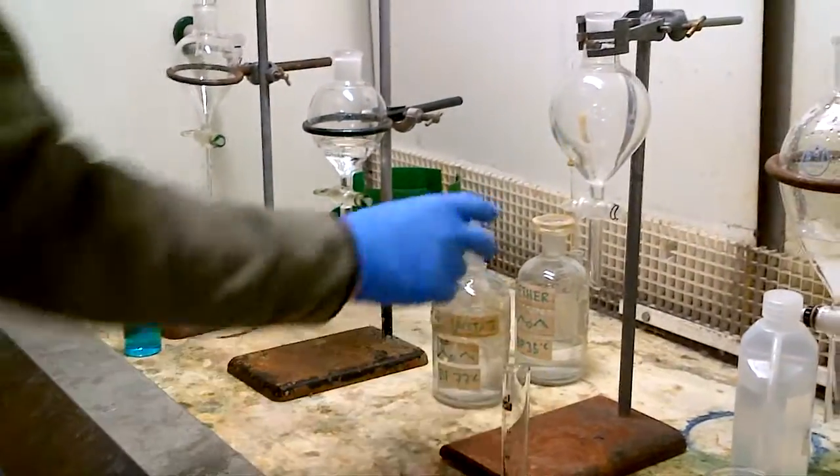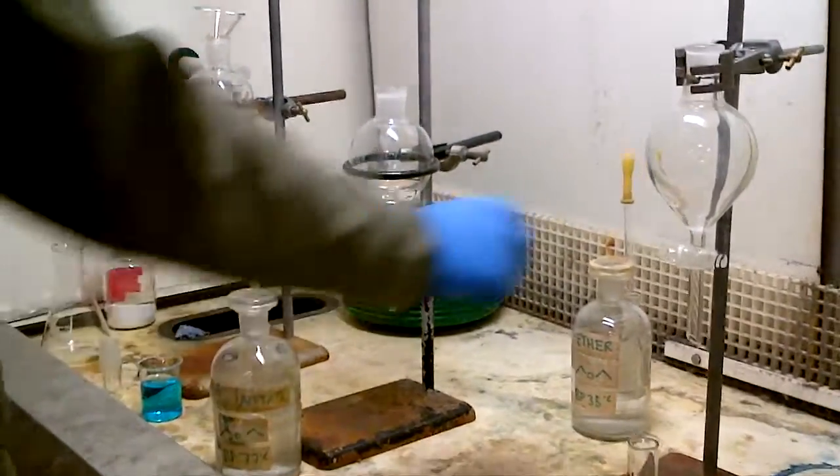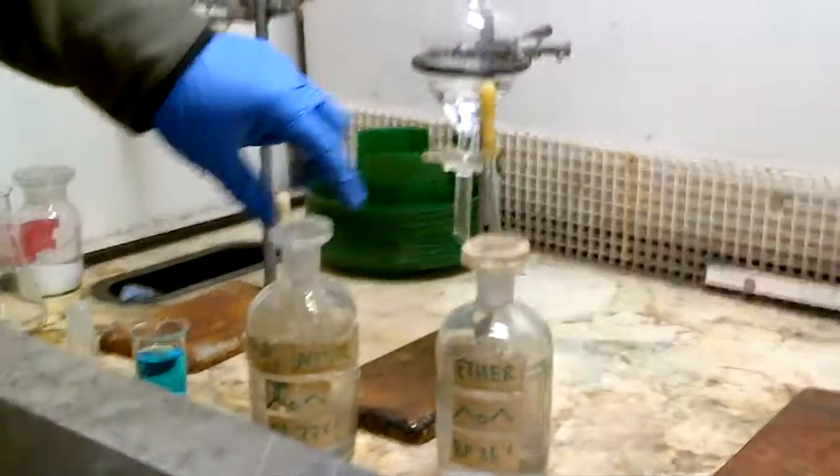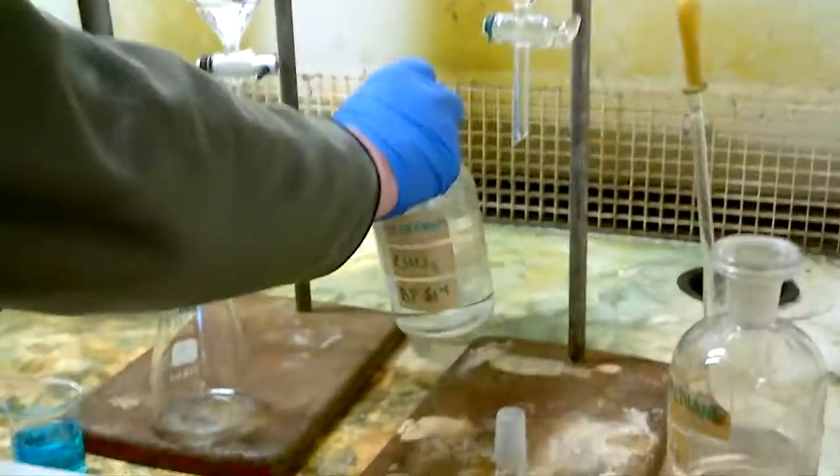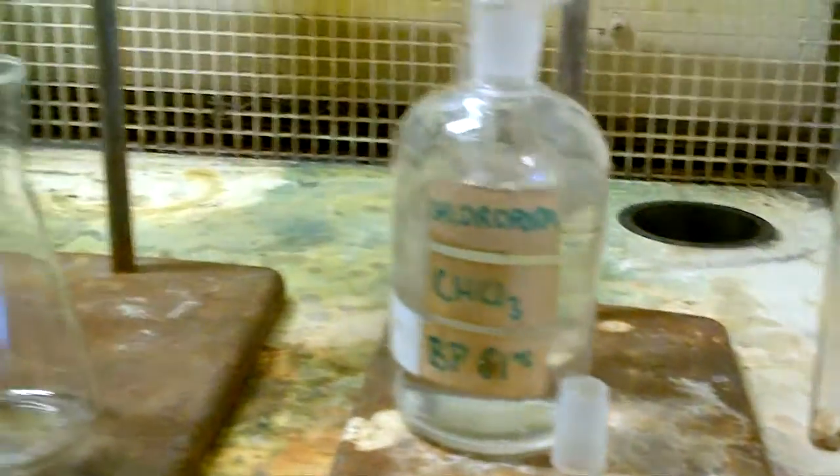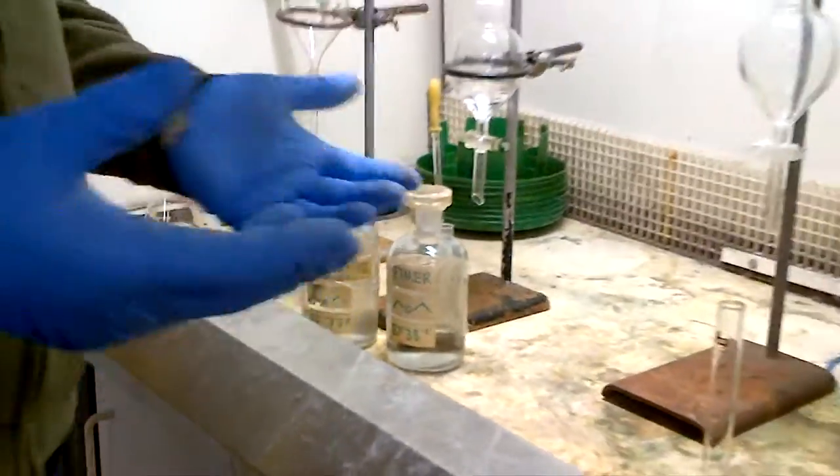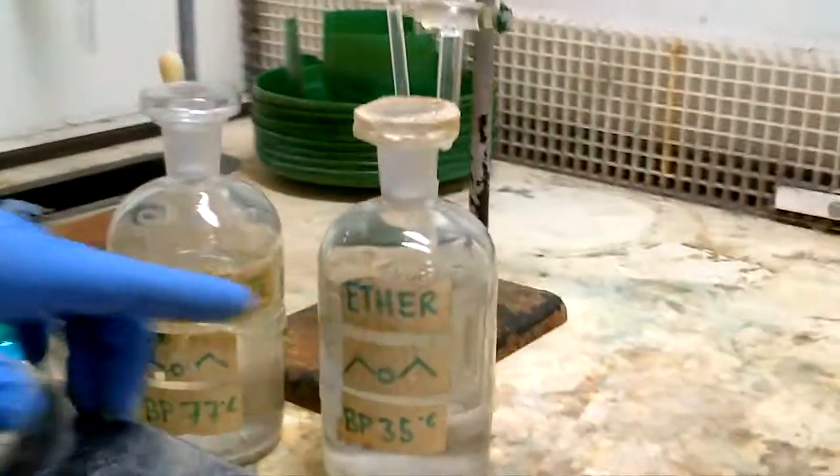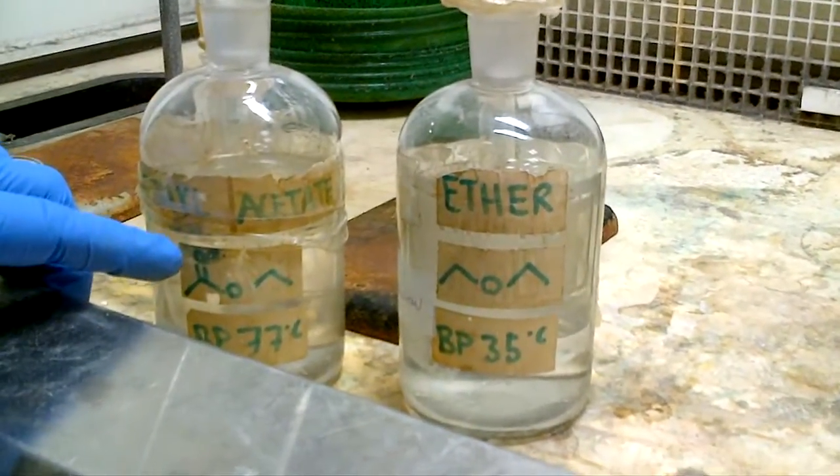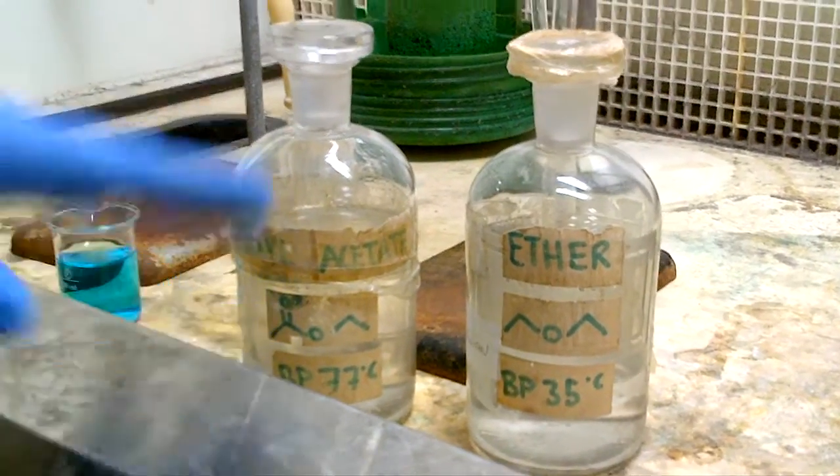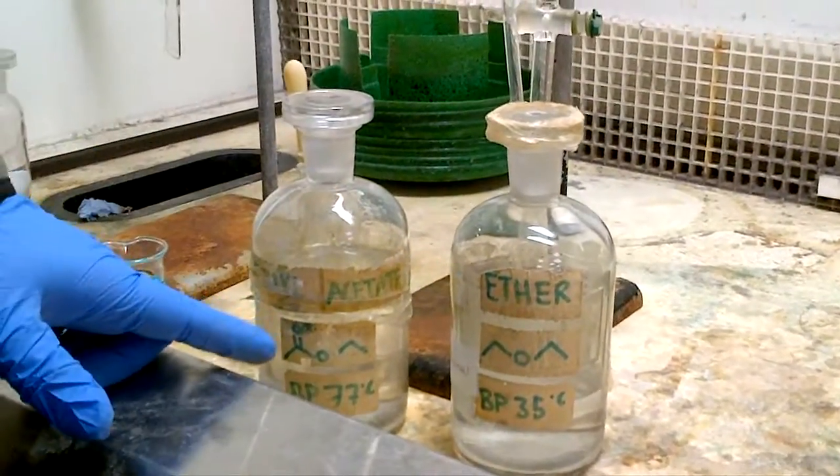So there's four real solvents we work up with in organic chemistry practicals and I've placed them in twos and tandems. This is ethyl acetate and ether, and then the next two in tandem are chloroform and DCM. And notice that I'm working from smaller bottles here, not big 2.5 litre winchester, we work from smaller bottles. Let me tell you about the densities, and the density of ether and ethyl acetate is numerically less than 1, about 0.7, 0.78 I believe, possibly wrong on that, but the densities are less than water.